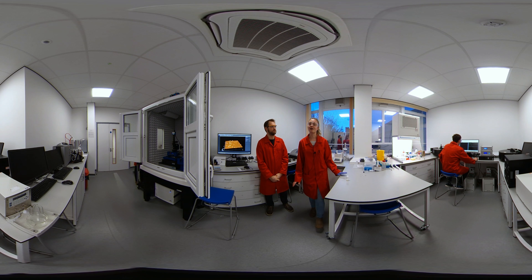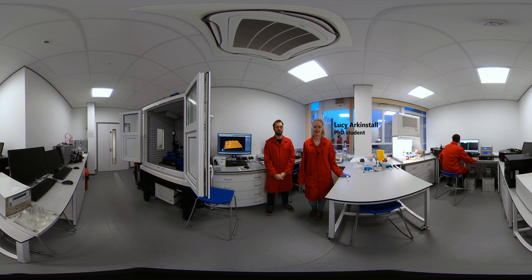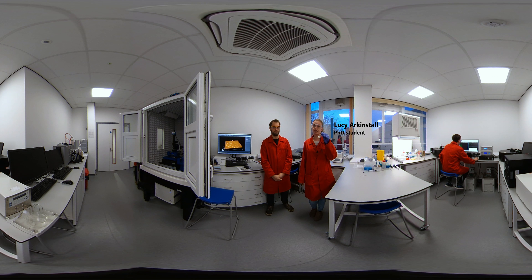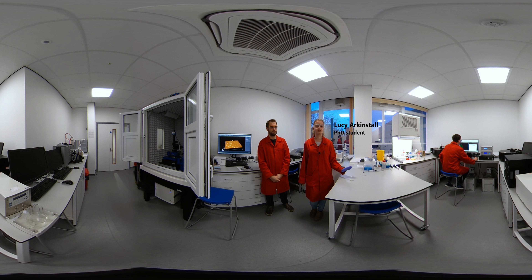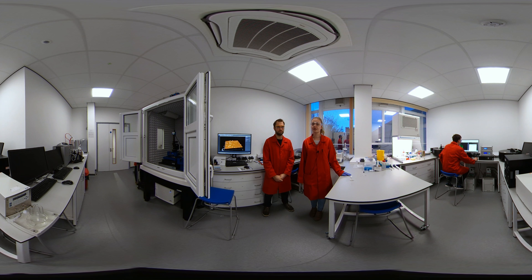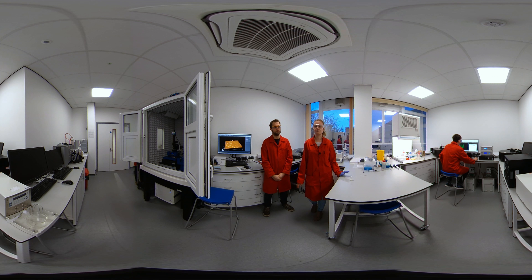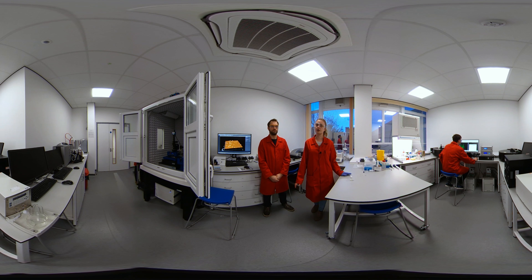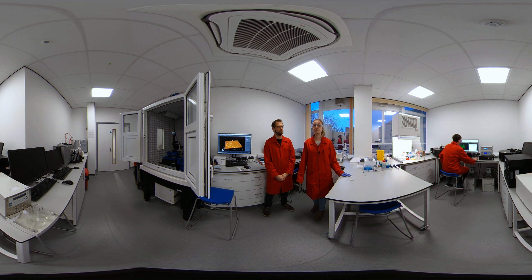We are here in one of our analytical labs — this is our particle sizing lab. We have here the particles that we made earlier, and in this room there are several instruments that we will use to analyze the size of the particles. This is really important for biomedical applications, because we want to know where in the body the particles are able to travel to, but also how they'll be excreted from the body.